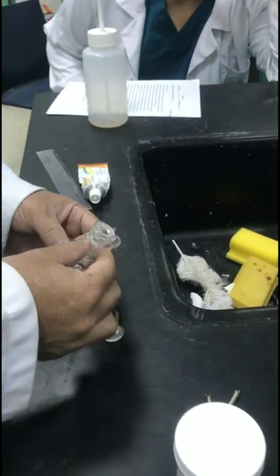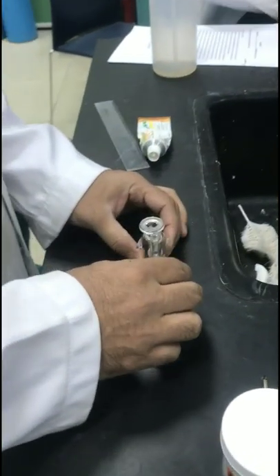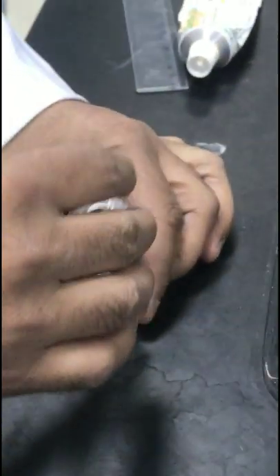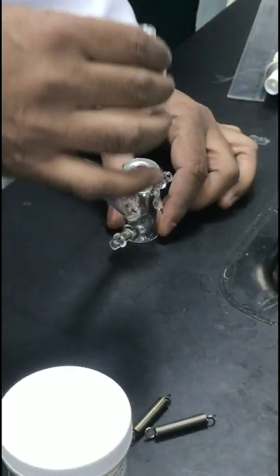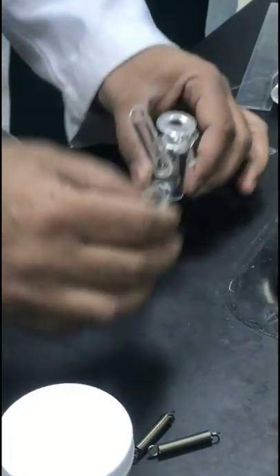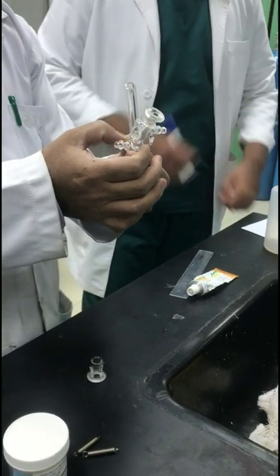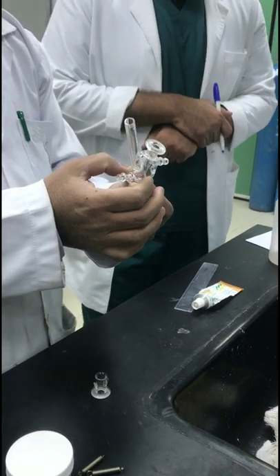As you can see here, this is called a Franz diffusion cell. It is a vertical type — you have a receiver compartment and this is called a donor compartment.